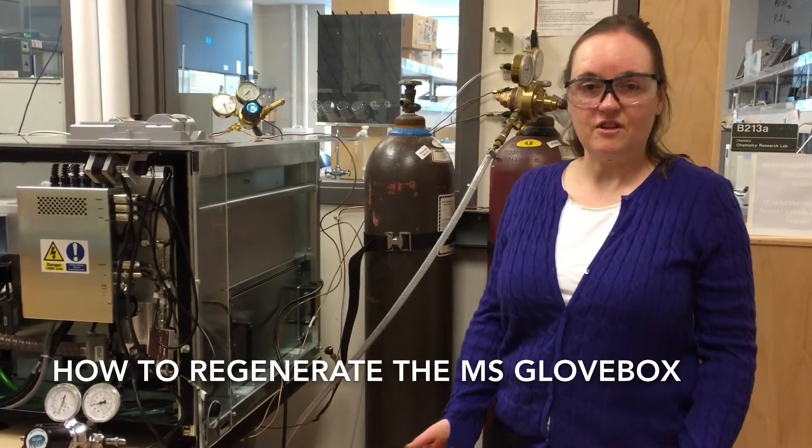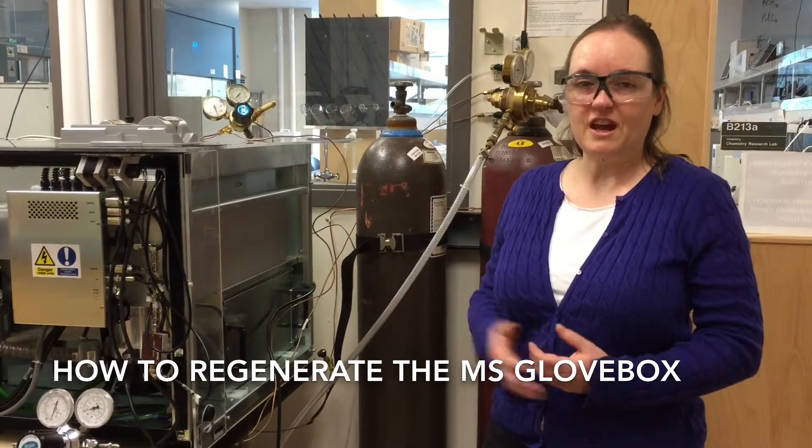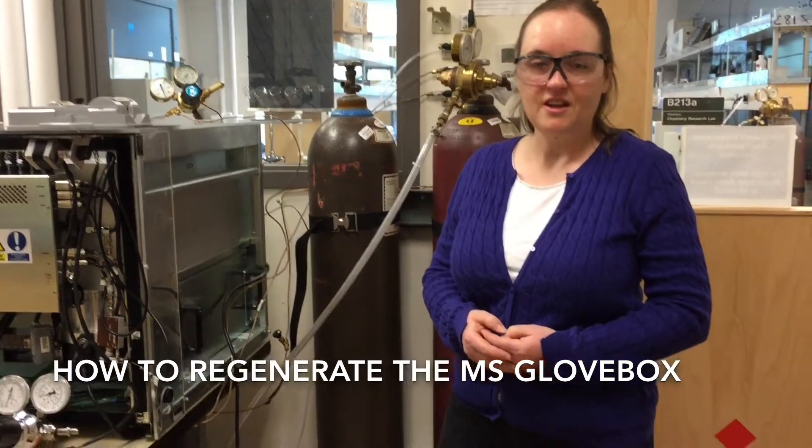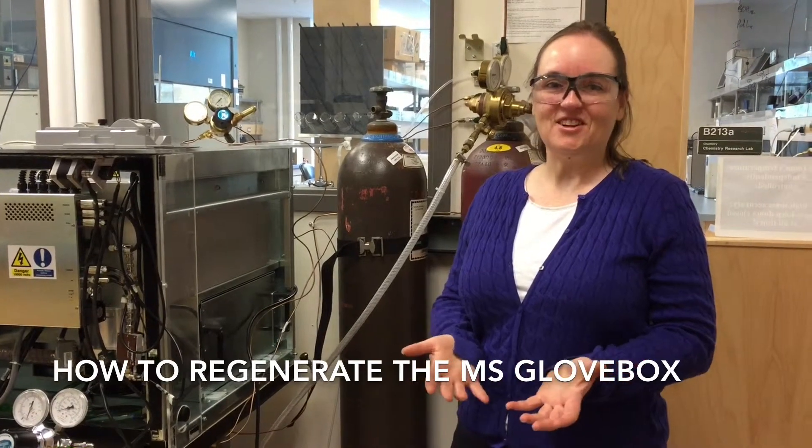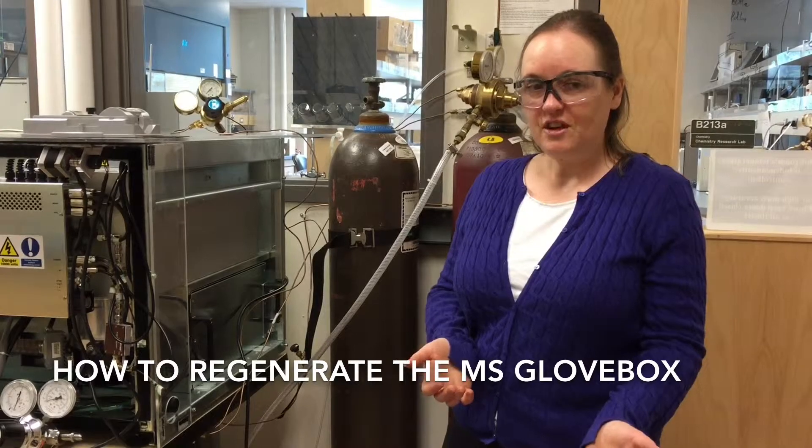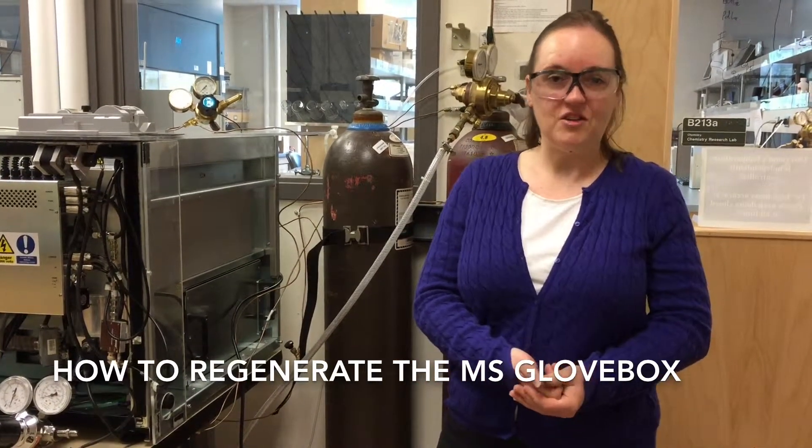From time to time, through usage of the glove box, there could be a bit of oxygen accumulation that happens, and of course we want to have a good nitrogen atmosphere in the glove box. And I've tested it, and we found that we need to do regeneration. So I'm going to start off first by explaining the gases that are used for regeneration of the glove box.